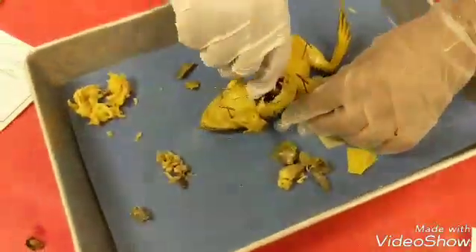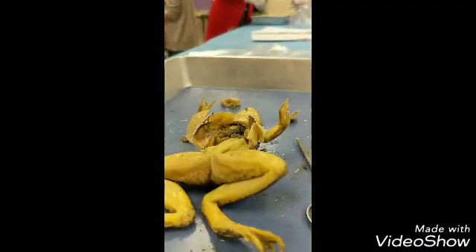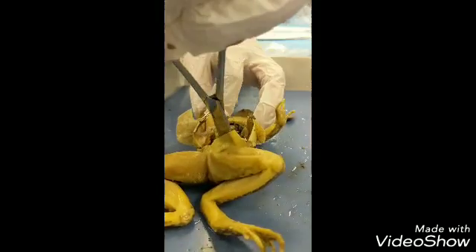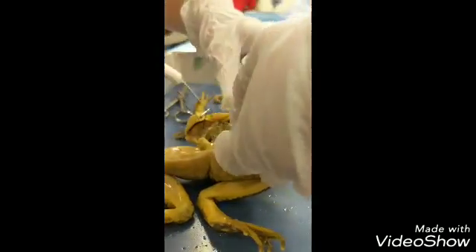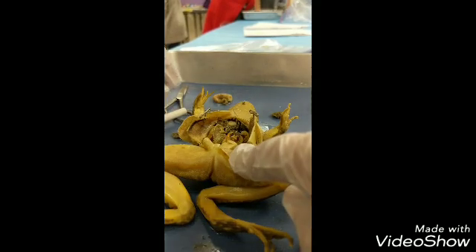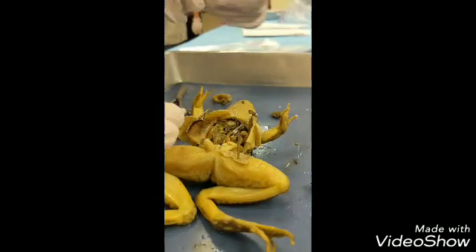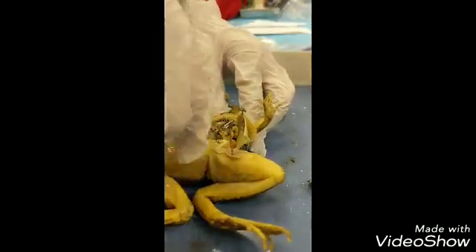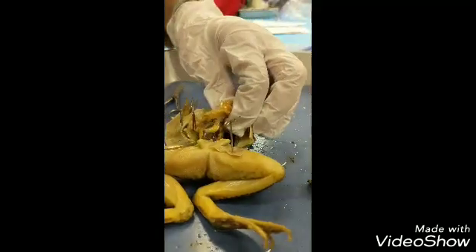He's actually showing the thing. Okay, there it goes. So we have to remove all the fat. Ours doesn't have that much fat — it's a skinny legend. We need to pin this little thing down. Pin that. Can't get it. Use these things. What is this? I can't get it out. I need help.